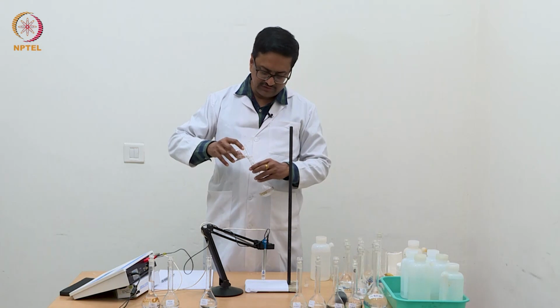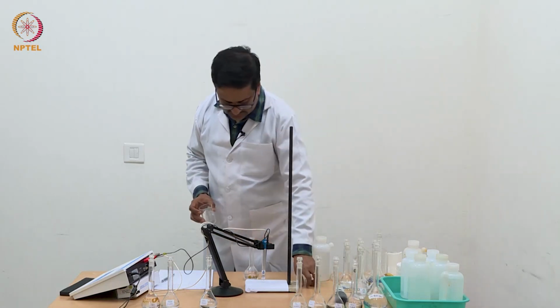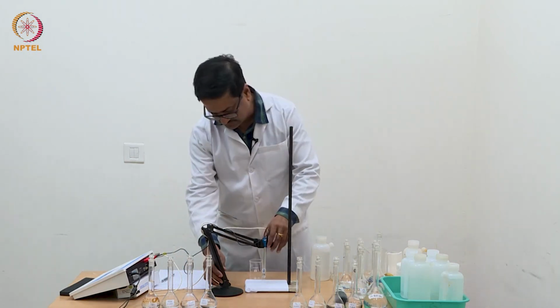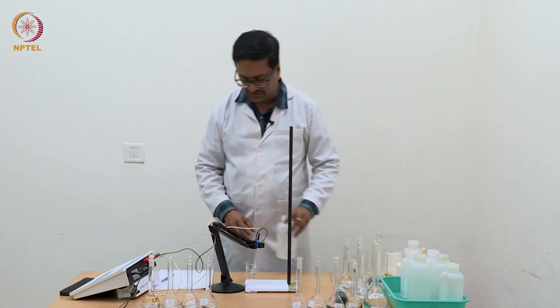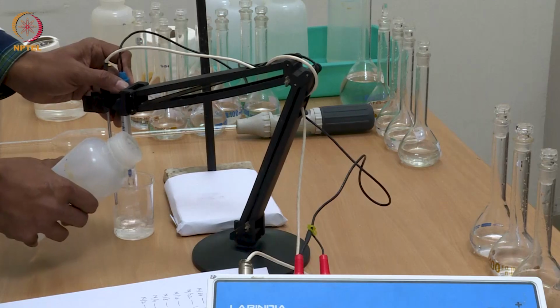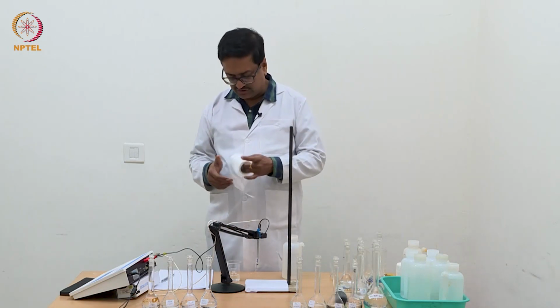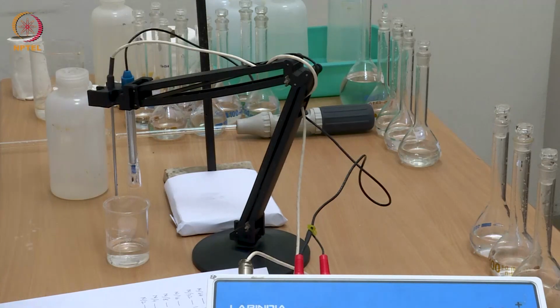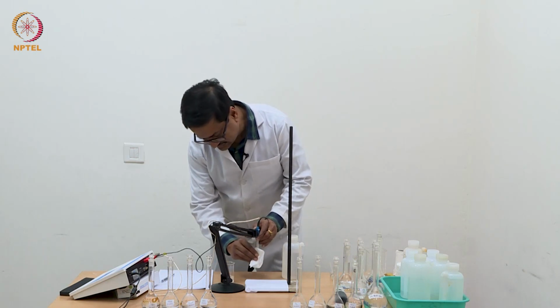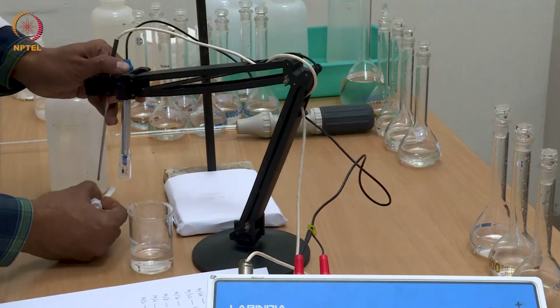So you can understand the reason behind it. The degree of dissociation of acetic acid is dependent on the concentration, and as a result the eventual conductance is different for an increase in concentration by 2 times compared to HCl. When we plot, we will be able to see the actual difference in these two sets of experiments. You will get a linear plot for equivalent conductance versus square root of concentration in the case of HCl, and you will get a curve for acetic acid for the same set of concentrations.